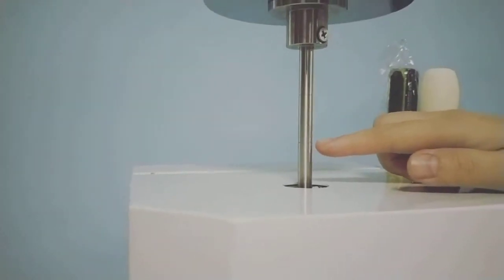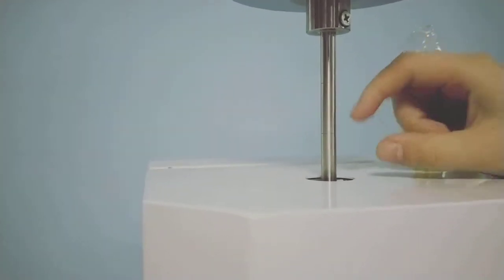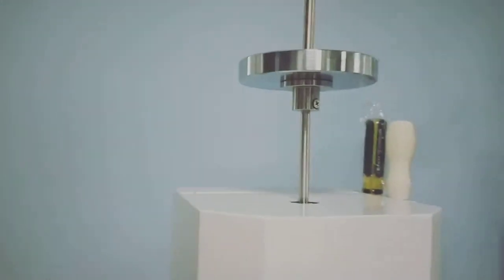We need to wait for the weight rod to move to this curve, and then automatically cutting. Now we can use manually cut. And this sample do not use.